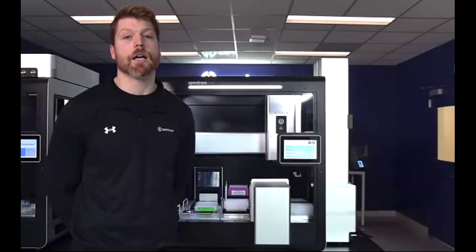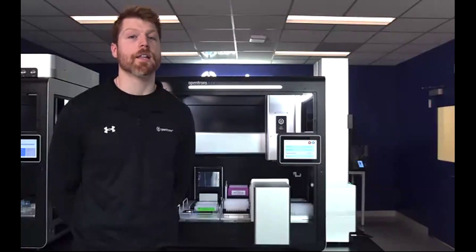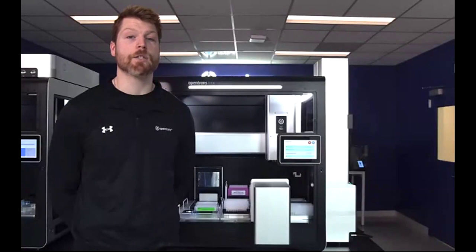Today, we're going to walk through automating your NGS workflow and more specifically, how the OpenTrons Flex high throughput NGS workstation sets you up for success with this application, including hardware features that we've already debuted, such as our 96 channel pipette, the OpenTrons on-deck thermal cycler, magnetic module, and then we're also going to be featuring the new Flex Stacker module, which allows you to increase your tip and plate capacity.